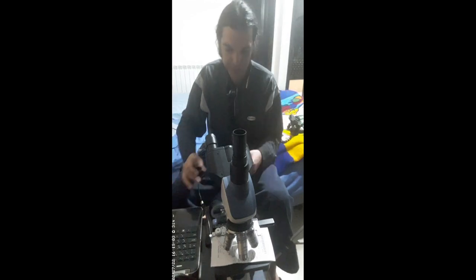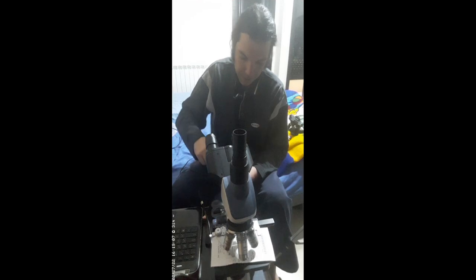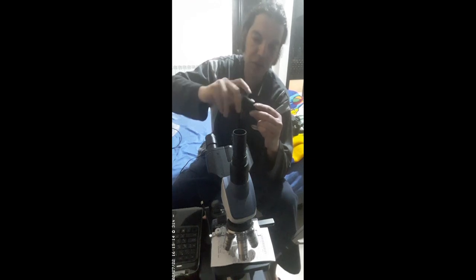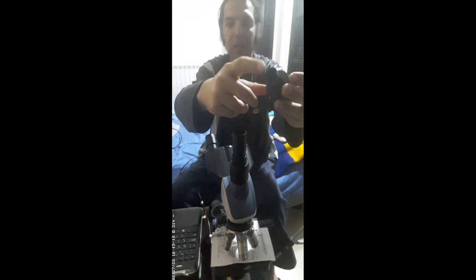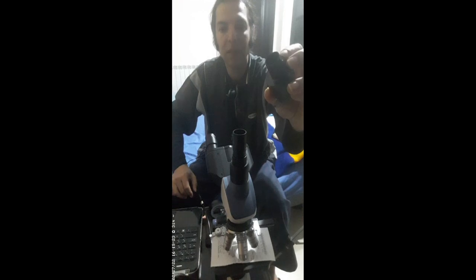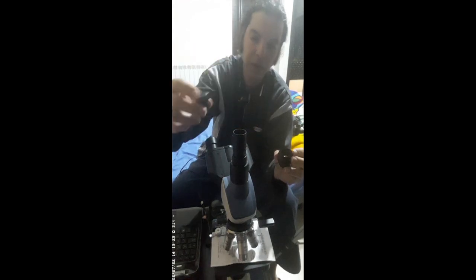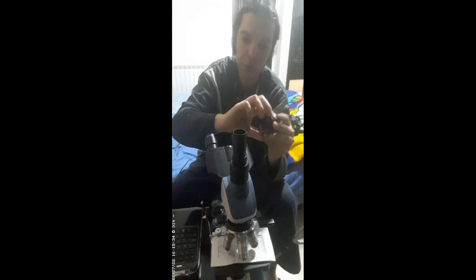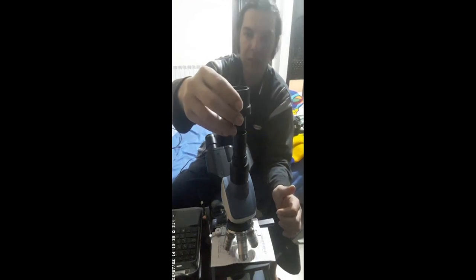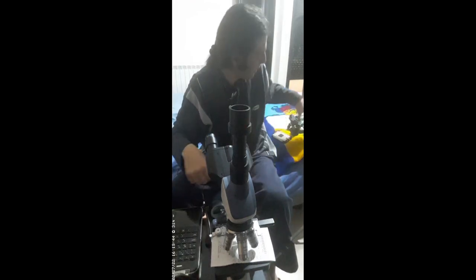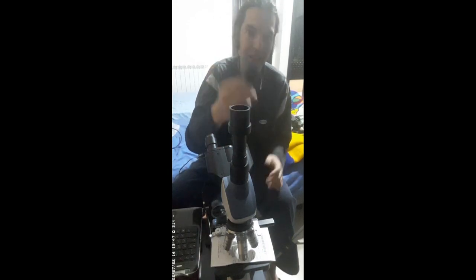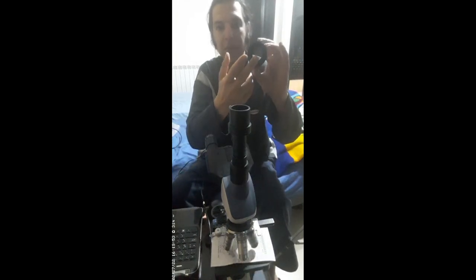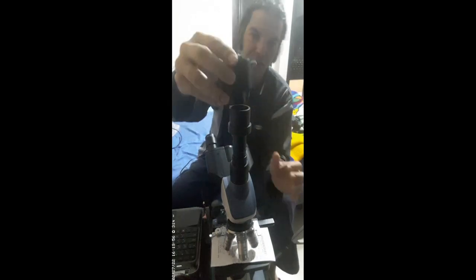I have to screw them together to get the conversion from the barrel of this microscope eyepiece. This small one is 23.2 millimeters. There's another one which is around 30 millimeters. I insert it over here. Next you need this converter. Here I have a 1.25-inch, here I have a 2-inch, so this way I can install this right here.